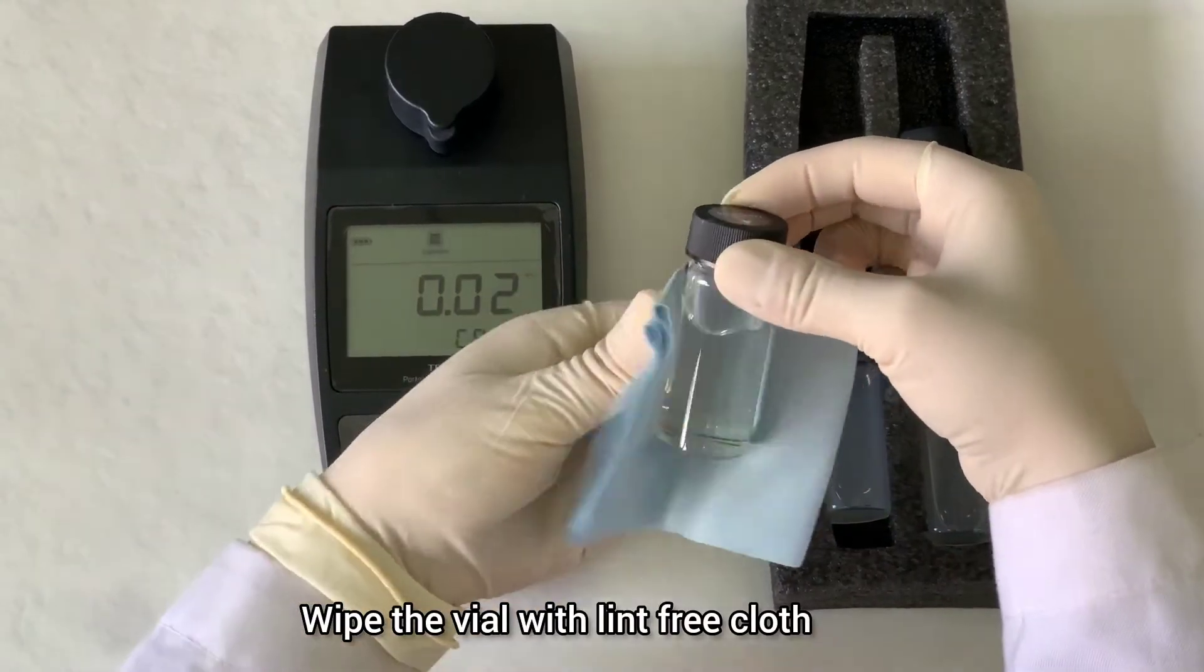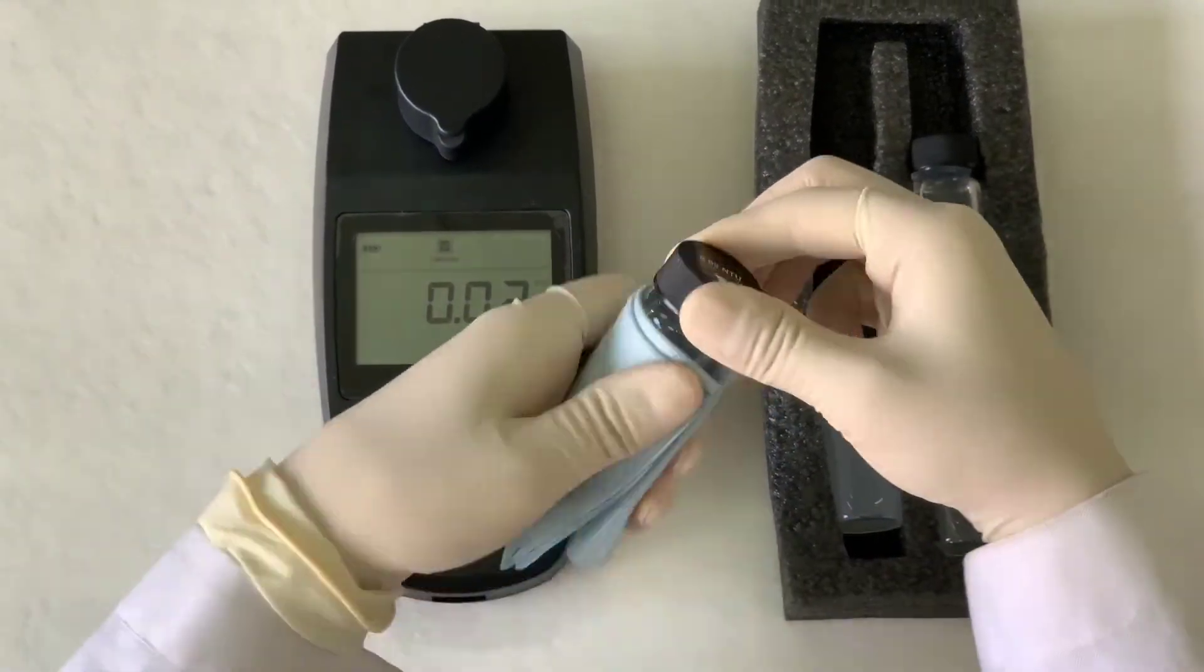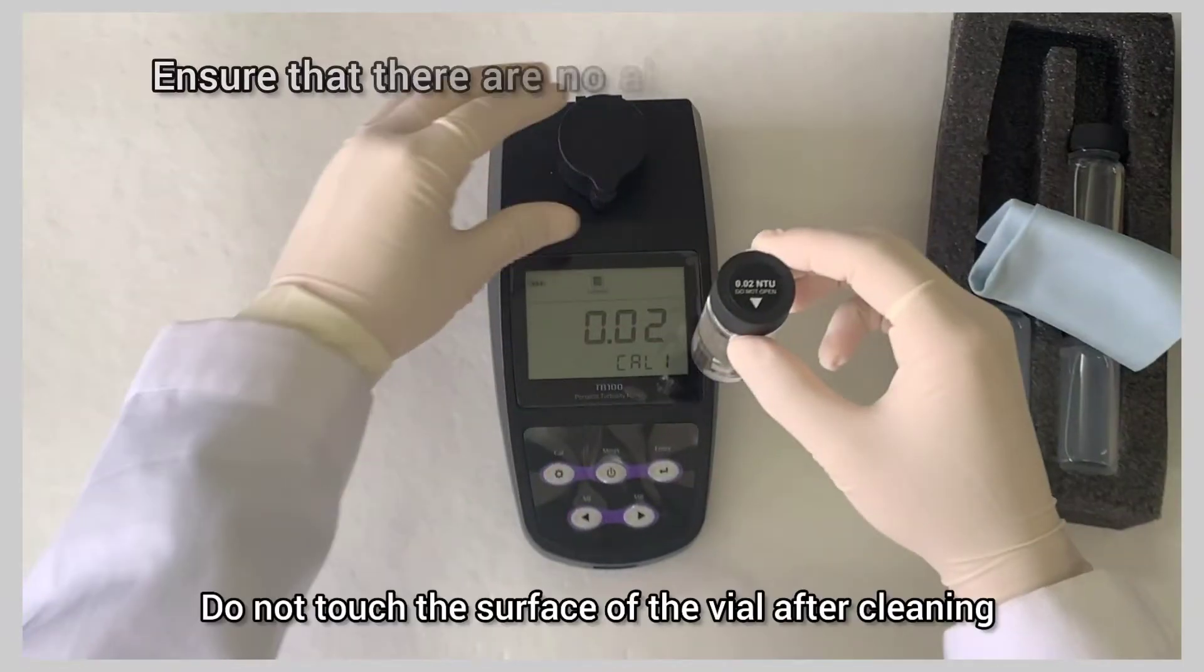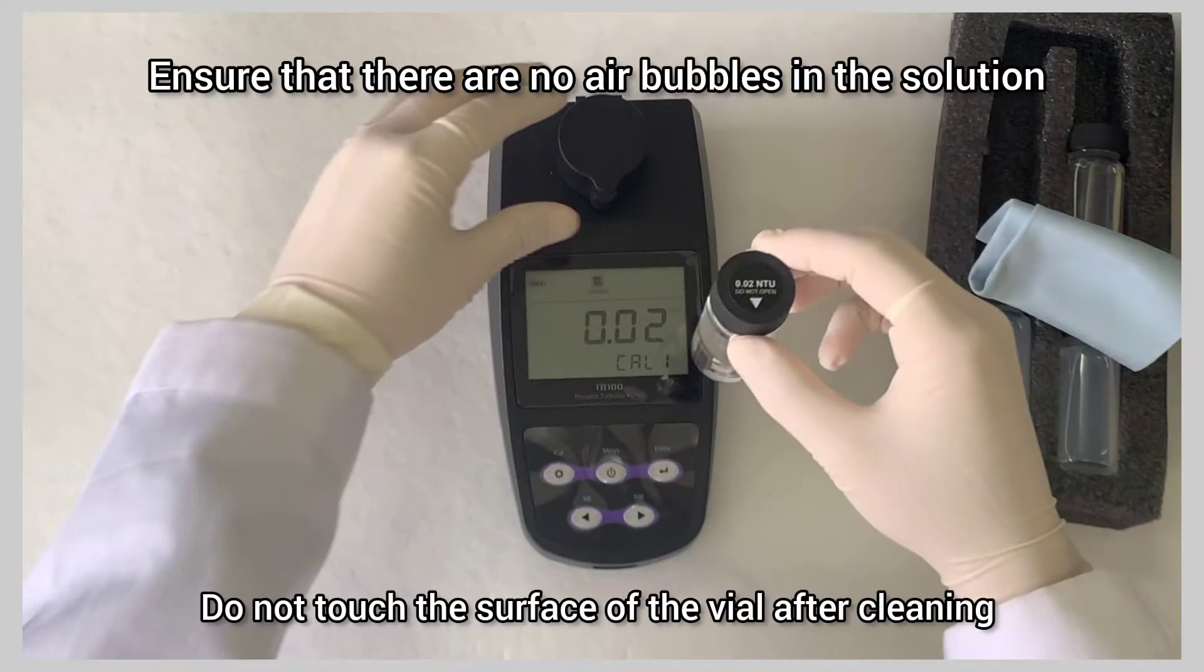Wipe the vial with lint-free cloth. Gently invert the vial several times to ensure that there are no air bubbles in the solution.